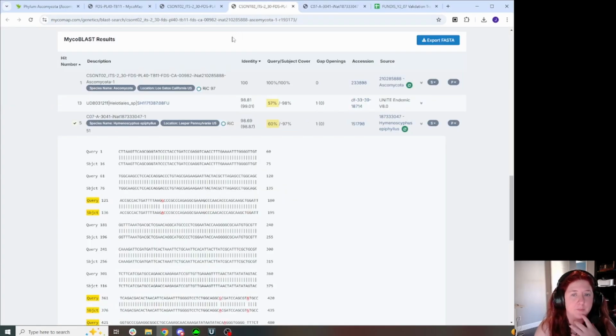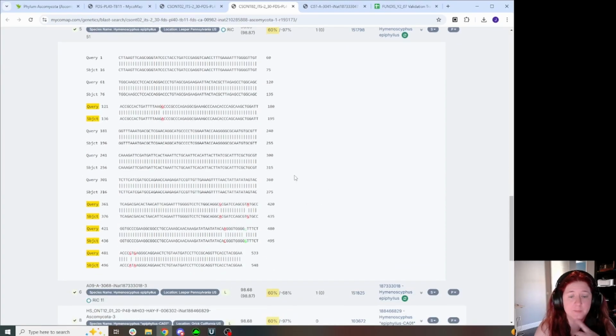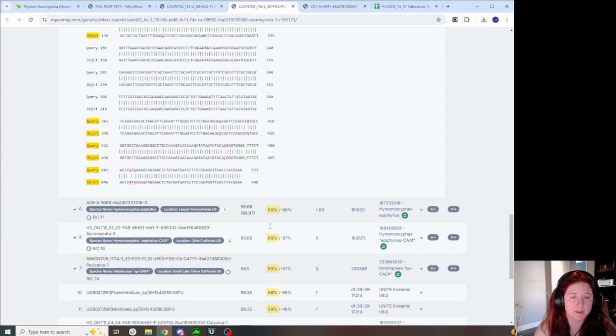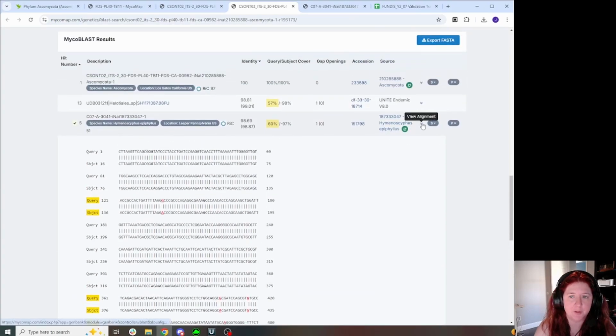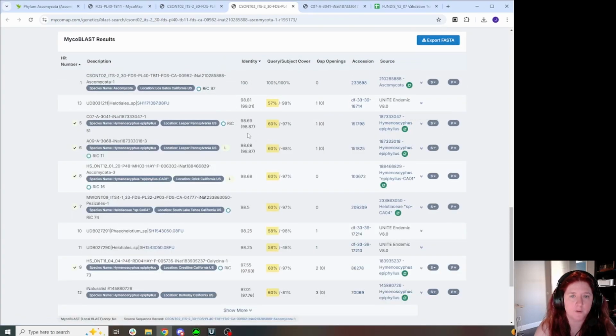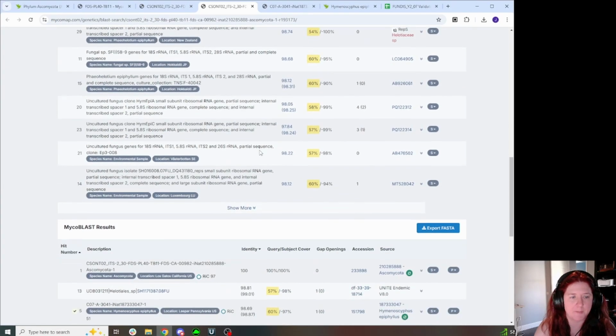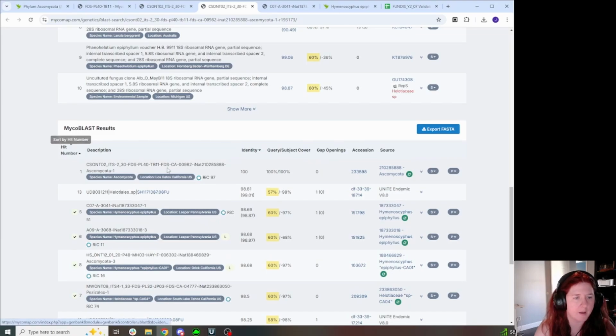We know these happen with ascos sometimes. And then I'm just going to continue with my validation as usual. I'm likely going to be putting a temp code on this one just because it's over a percentage away from the next closest specimen sequences that we have here on Mycomap and the local BLAST. Actually, let me reorder that.